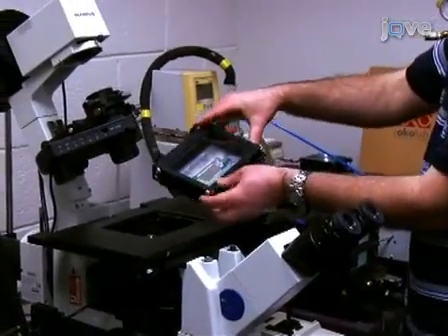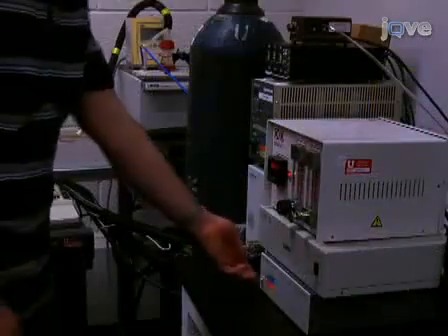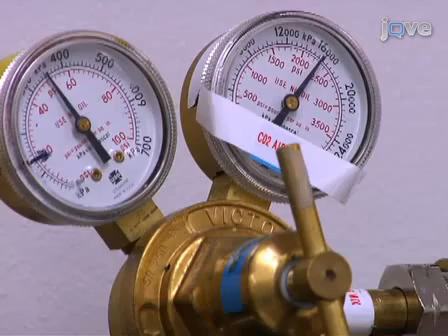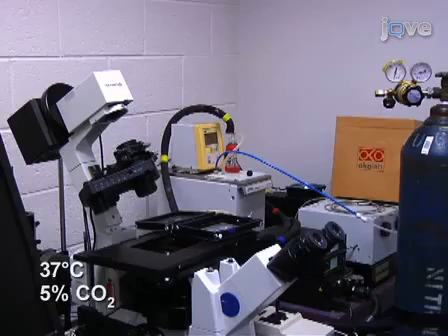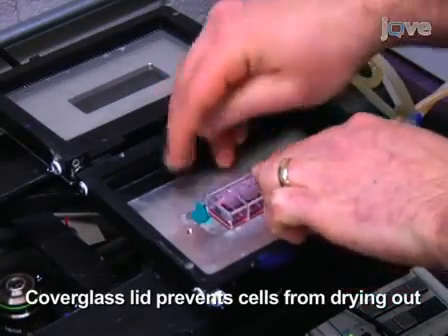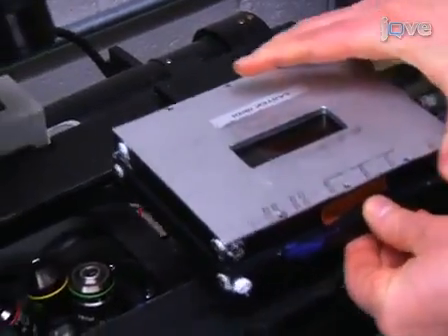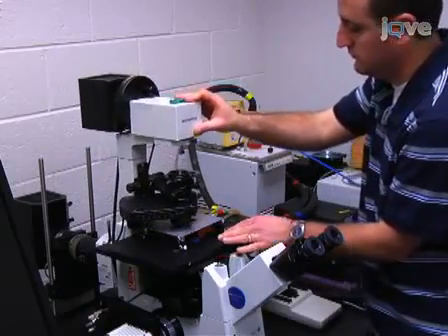The image acquisition setup consists of a customized cell incubator that fits on the stage of an inverted microscope, which is controlled by image acquisition software. To prepare for image acquisition, ensure that the incubator is pre-warmed and equilibrated. Next, open the lid of the incubator and place the cells, with the chamber lid on, in the adapter. Use a small amount of modeling clay to hold it in place. Close the lid and position the entire incubator on the microscope stage, ensuring that the incubator is firmly in place.